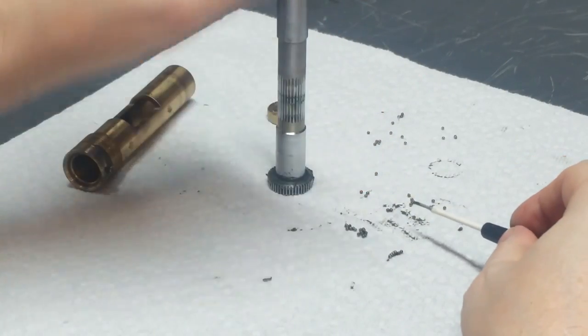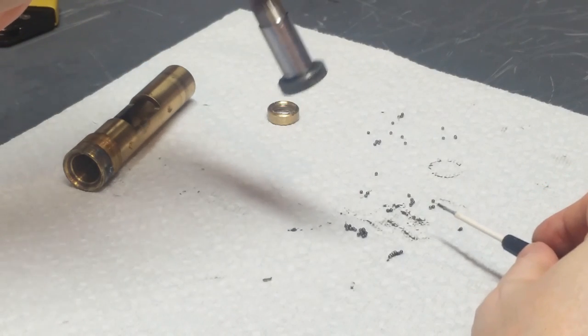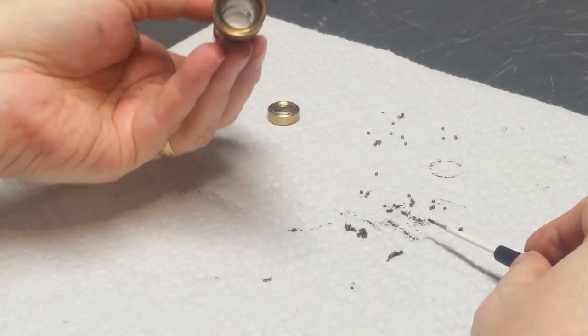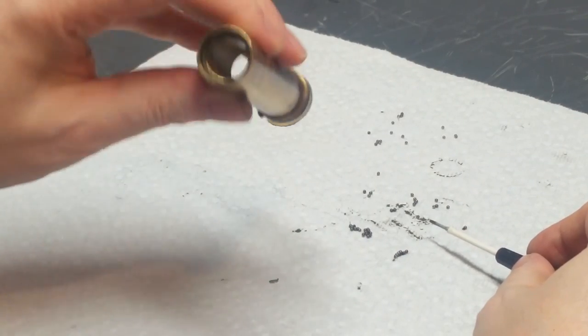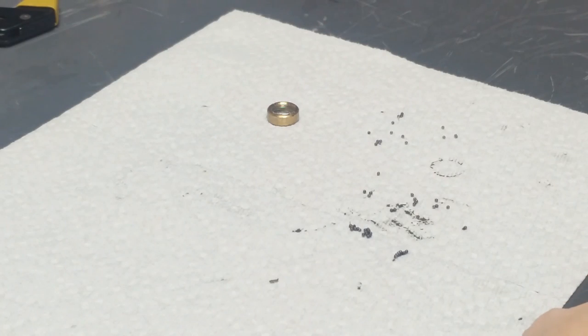Okay, make sure that there's none still clinging to the hardware here. There's not. Similarly, check both ends. So it looks like we've got them all accounted for. So in theory, there ought to be 60 of them here.